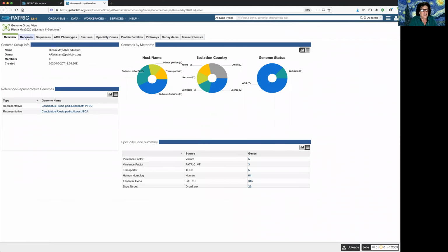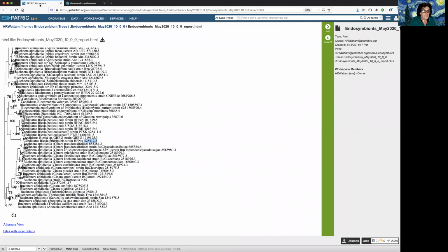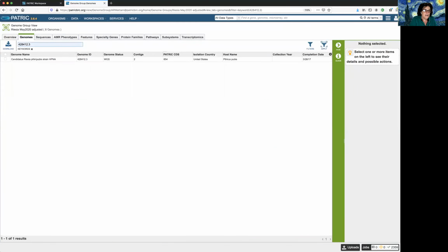Here's all the metadata. Let's go to the genomes, the second tab there. Now I have two tabs open because I want to look back and see what the problems were. One of them is this guy, this HPNA with that number. So that genome ID number, I could put that directly there in the filter box. Click filter, and then that's the genome that we were having problems with.